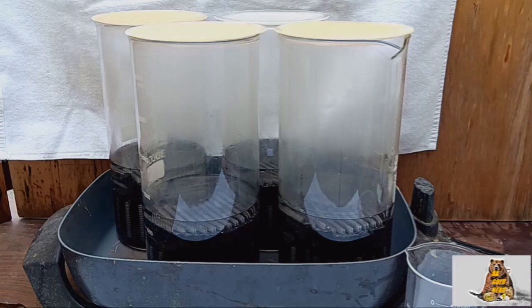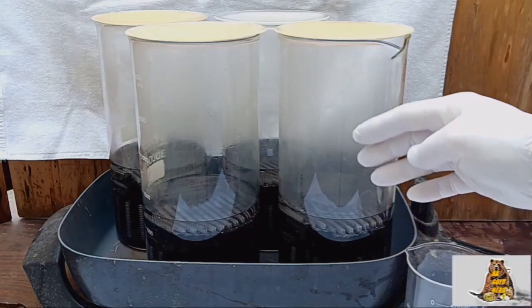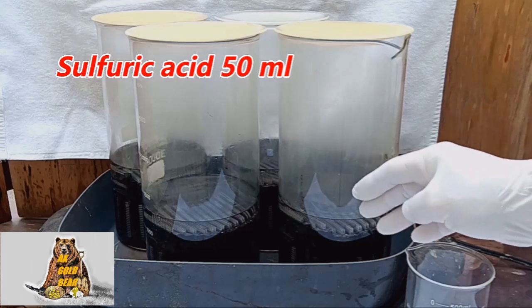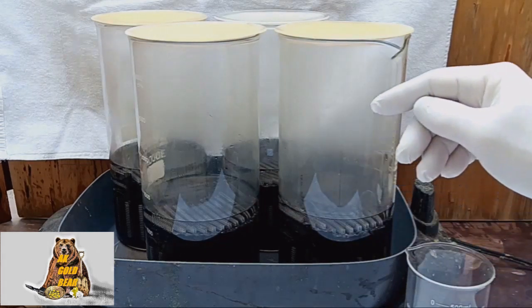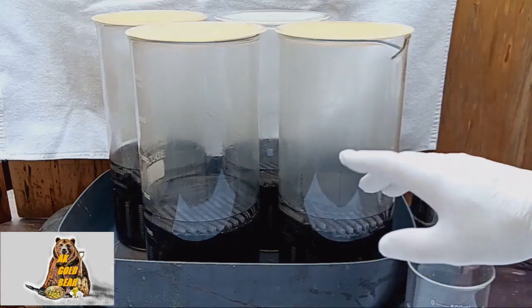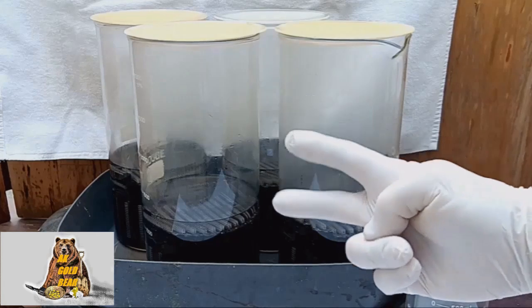To remove the oil or whatever it is, I mix 500 milliliters of water with 400 milliliters of concentrated hydrochloric acid and 50 milliliters of concentrated sulfuric acid. Now I will boil the connectors for at least two hours.